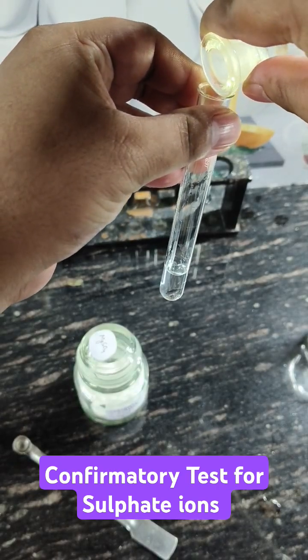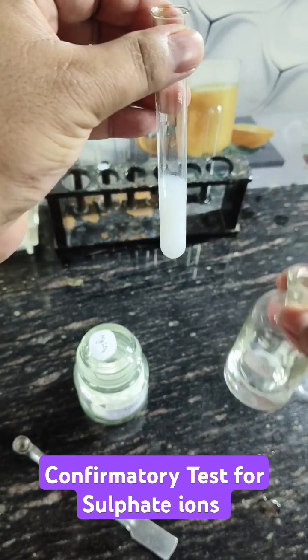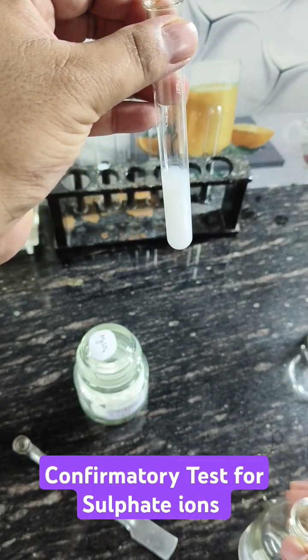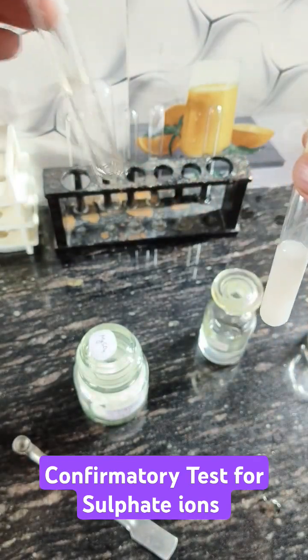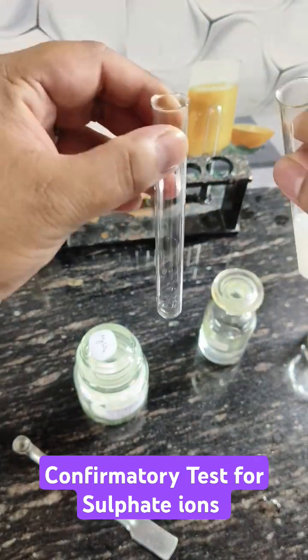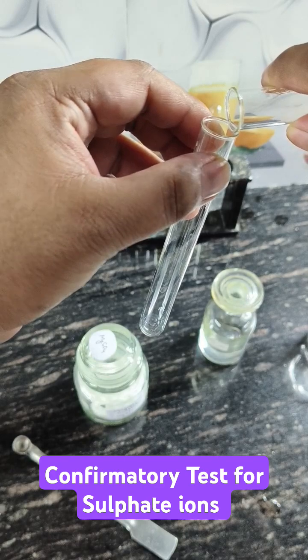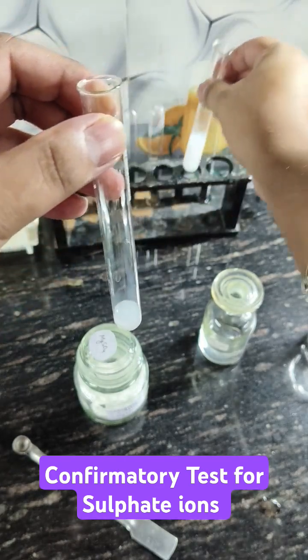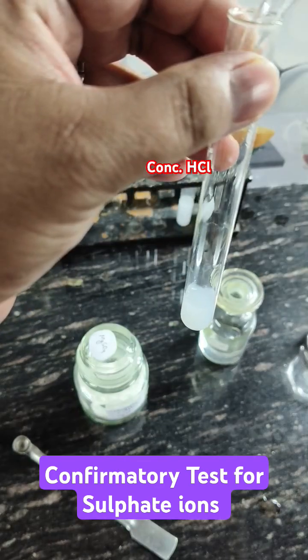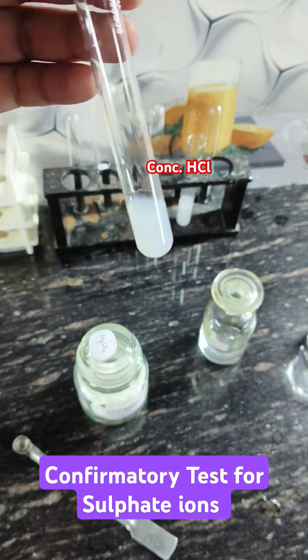Here in my test tube, white precipitates are produced after adding barium chloride. I will take 2 ml of this and add hydrochloric acid in concentrated form. The precipitates do not dissolve, which confirms sulphate.